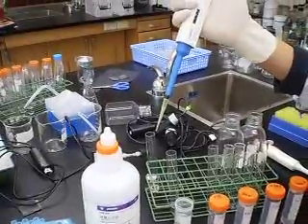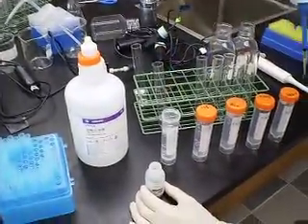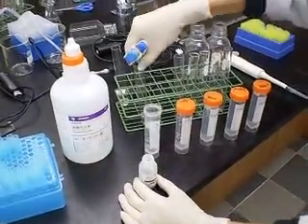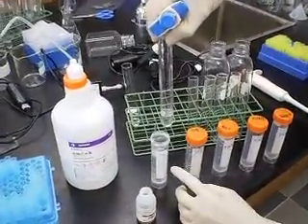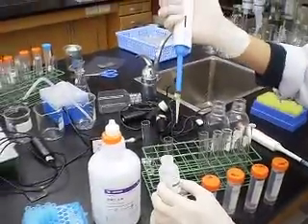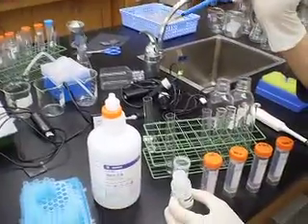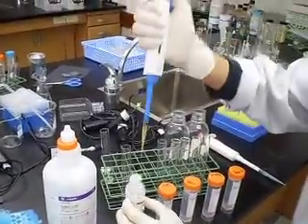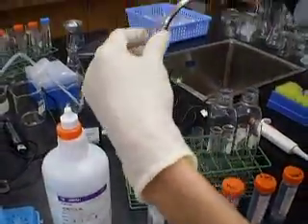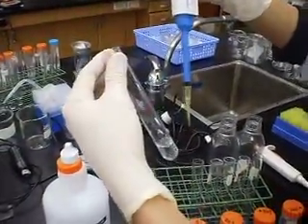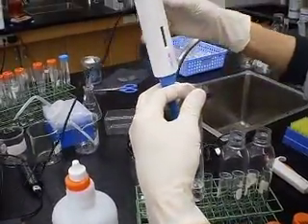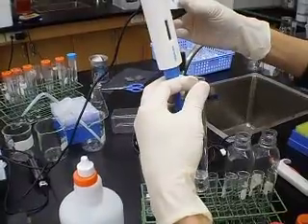Micropipette, 10 microliter. So volume will all be the same but only the different concentration will be used. So I'm only going to demonstrate 3% of hydrogen peroxide with the same amount of catalase enzyme. I'm going to fix it to 10 microliter, small amount. And I'm going to add into this hydrogen peroxide. Once added into it, immediately you're going to capture it because the pressure will build up.